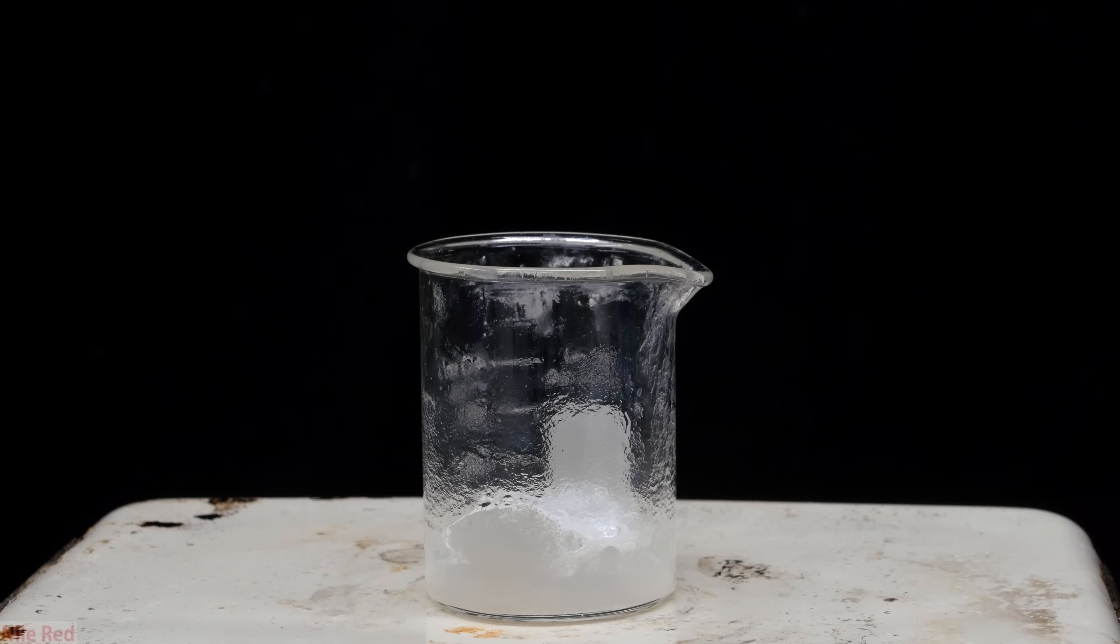At this point, I think it's important to tell you guys just how unenjoyably bitter the denatonium benzoate is. During these steps where the acetone was evaporated, enough denatonium benzoate gets into the air to make your mouth unpleasantly bitter. The small amount that travels out of the beaker when the acetone's evaporated will actually settle on your face, and if you lick your lips, your mouth will become really bitter. Even if you wash your face repeatedly, the bitter taste is going to be there for a few days.